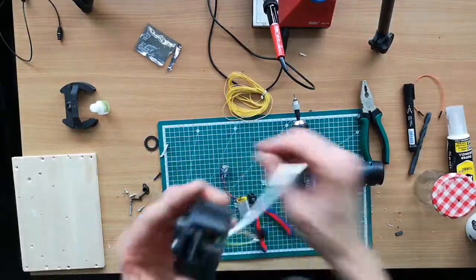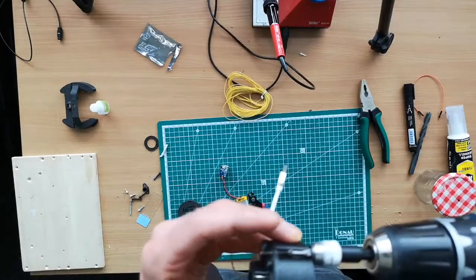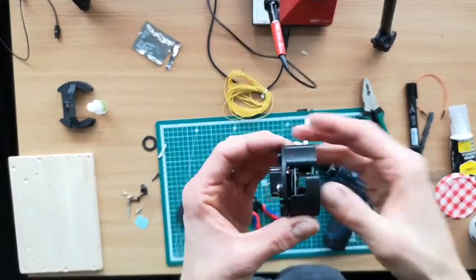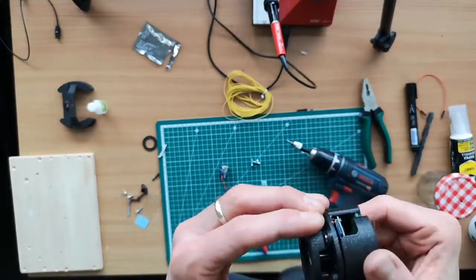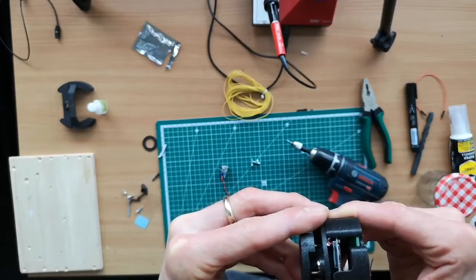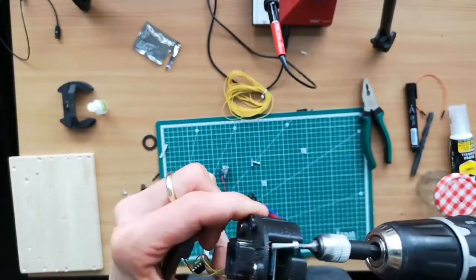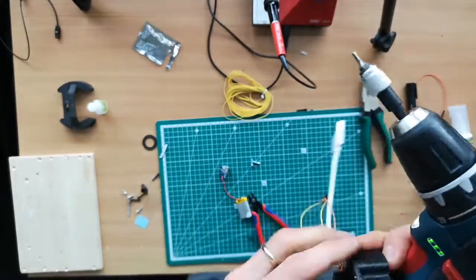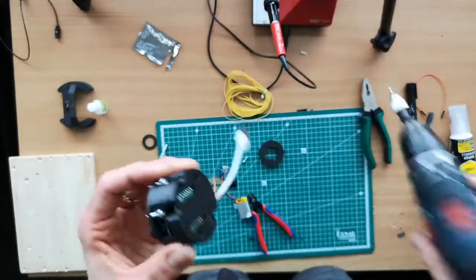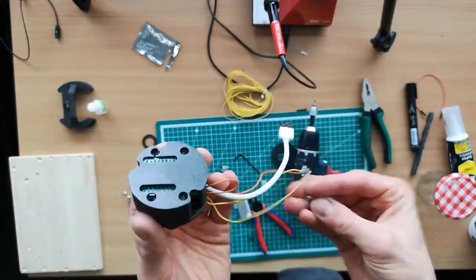And so the next challenge is to create the focusing mechanism. For this we have to place screws inside the holes that are pulling the whole mechanism towards the camera. So for this we have these M3 screws again, yours can be different. And so we insert them in the holes here. Its advantage is to use the Allen key, because this is longer. Your tool may differ.